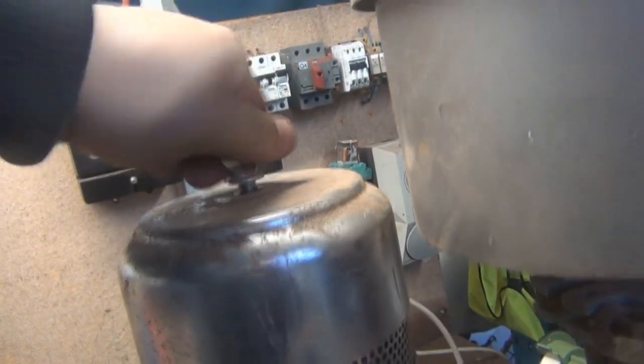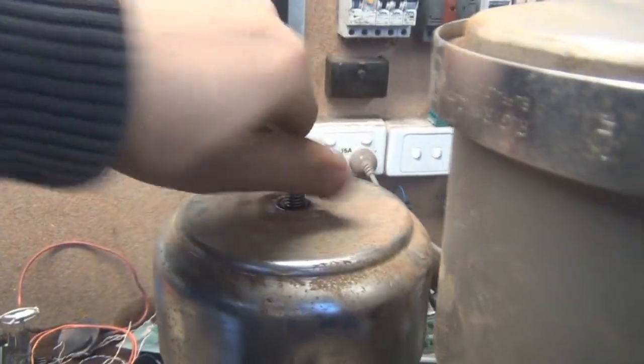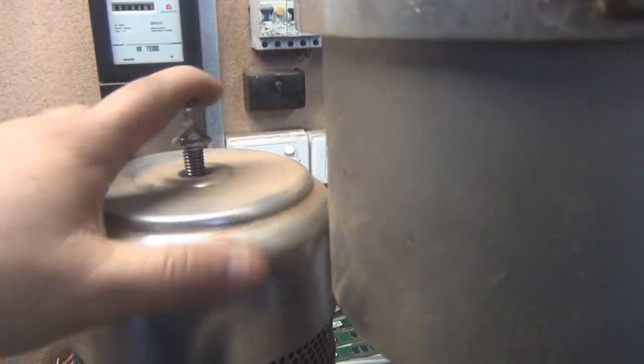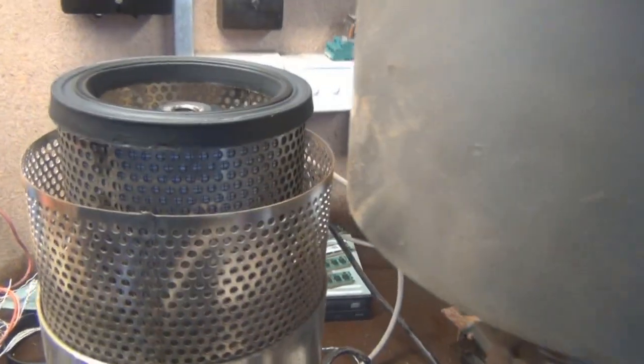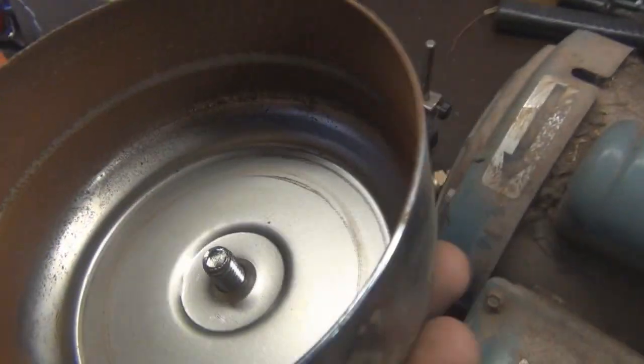I have a feeling this hasn't been used in a million years. It's so mucky and grimy. See, that's the exhaust filter — it's full of red dust. I betcha this was up north.